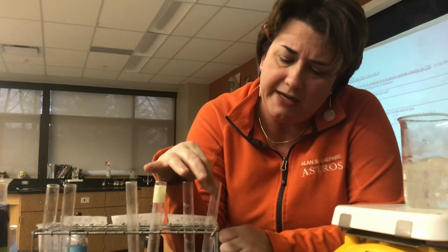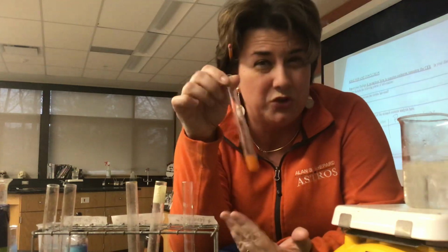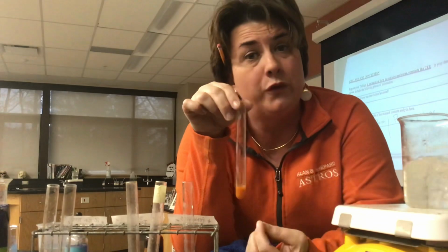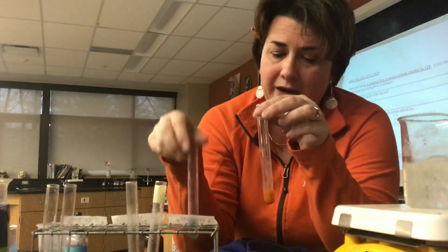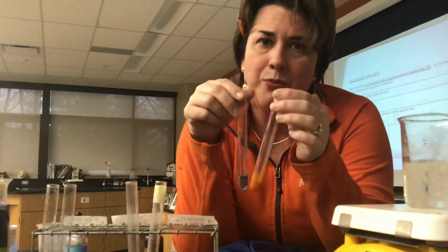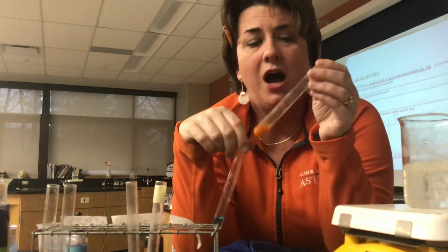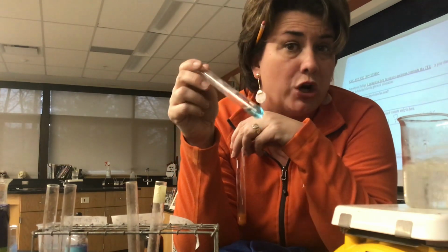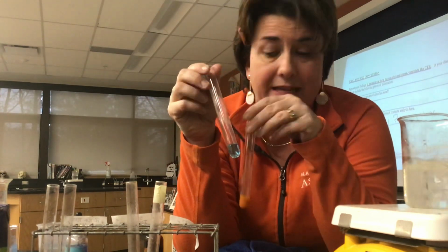So what you can see here is that in the presence of a sugar, Benedict's will turn kind of a reddish orange color. Really what we look for is a color change. So it started off as blue, and I know that because water did not react. So it started off blue, and in the presence of some heat, and the Benedict's with honey, which is a very simple sweet sugar, turned orange, and my negative control, my water, did not turn at all, so it stayed the same.